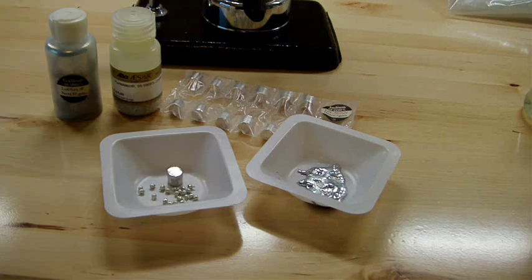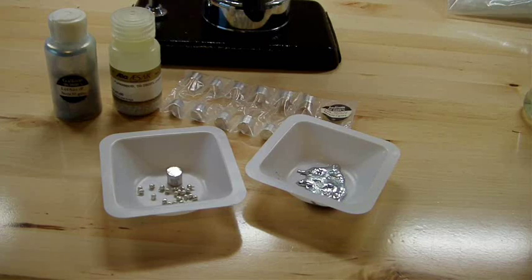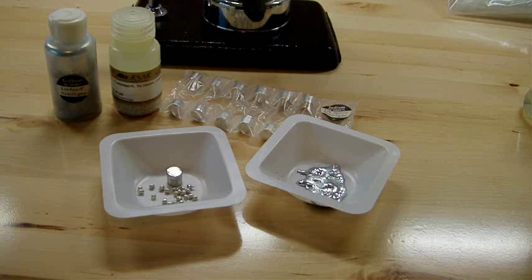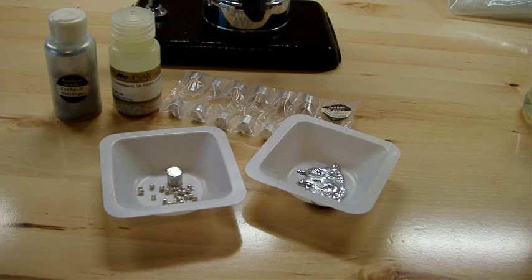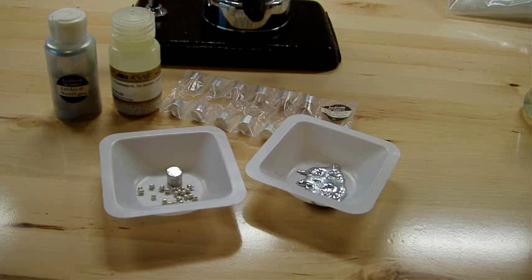So all you need to do to make this is just melt all of these elements together, which is fairly simple because they all have very low melting points. As I said, gallium's melting point is just slightly above room temperature. Indium is a little bit above that. It will melt on a fairly hot day if it's in the sun, and tin is a bit higher than that.